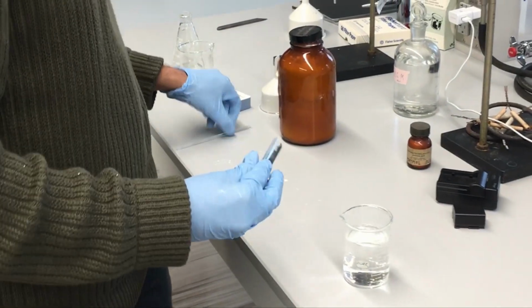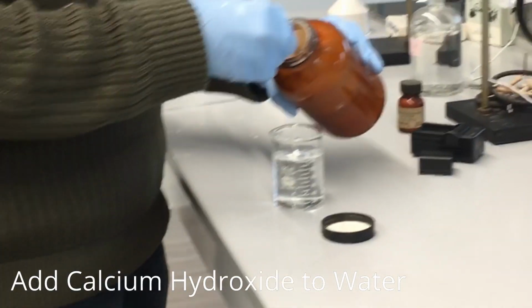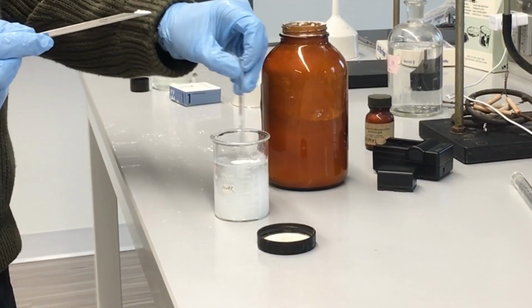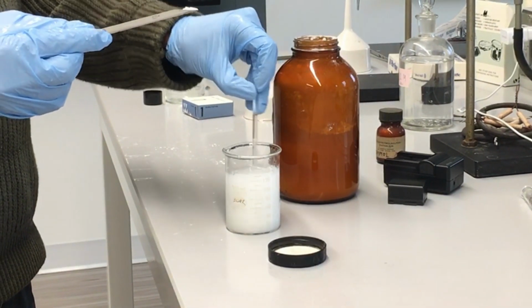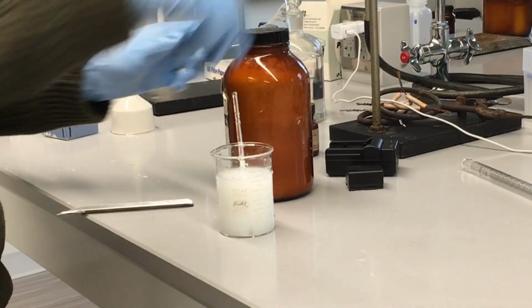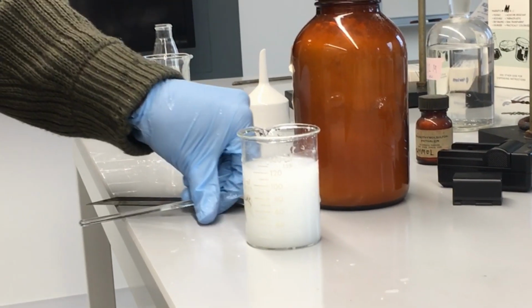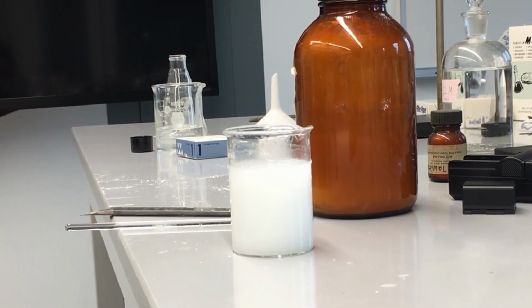All right, so to start off, we're first going to want to saturate calcium hydroxide by adding it into water. Now, saturation means that we've added so much of the solute, which in our case is calcium hydroxide, into the solvent, which is water, such that no more of the calcium hydroxide can dissolve. We know we've reached the saturation point when we notice that solid calcium hydroxide starts to form at the bottom of our beaker here. That means that every little piece of calcium hydroxide solid we put in will force some more calcium hydroxide to fall out of the solution, i.e. become its precipitate.